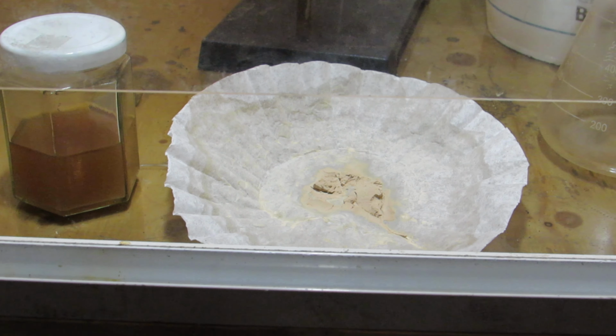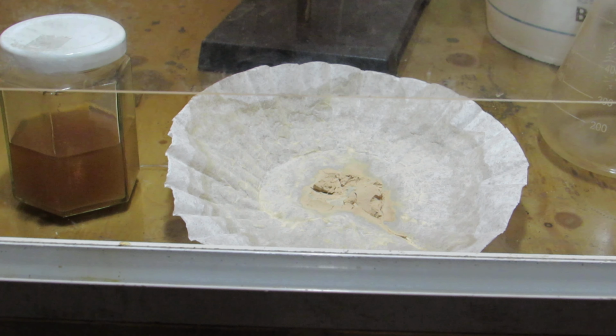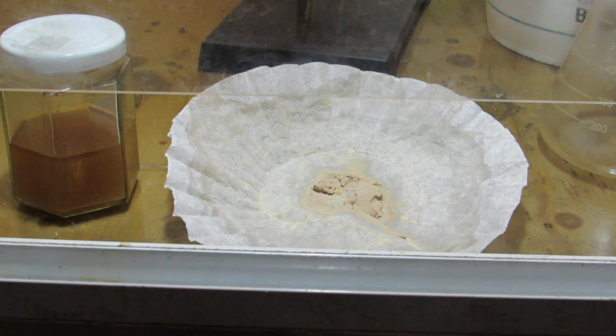As a side note, diethyl ether is very flammable and must be kept at low temperature away from ignition sources. It should also not be inhaled.